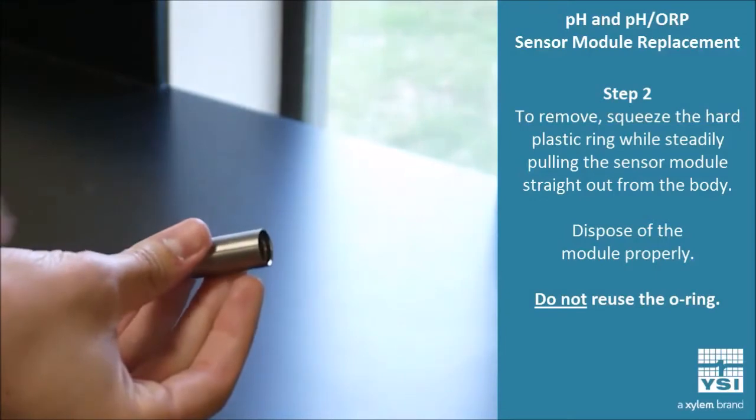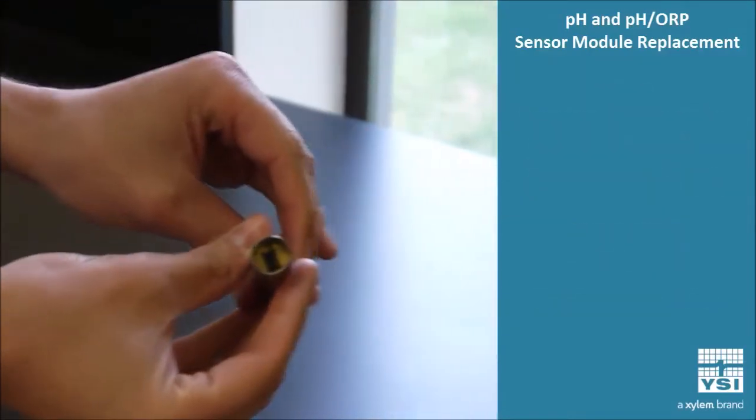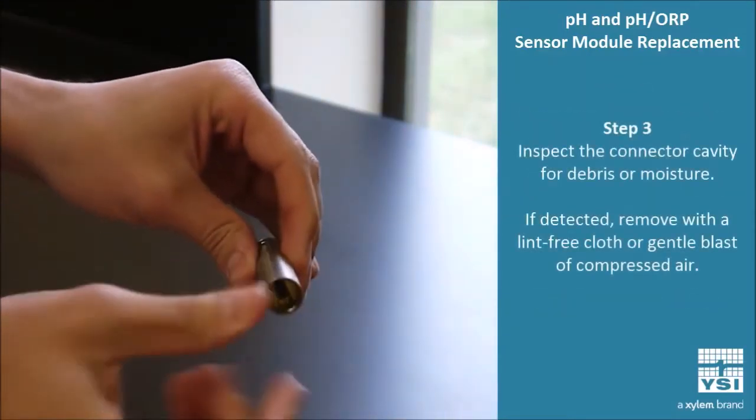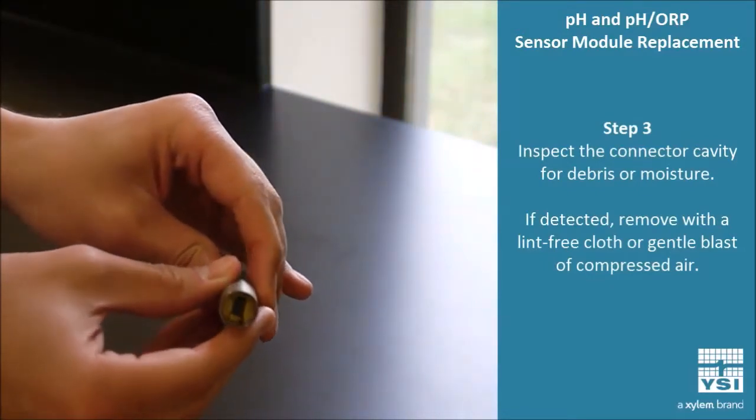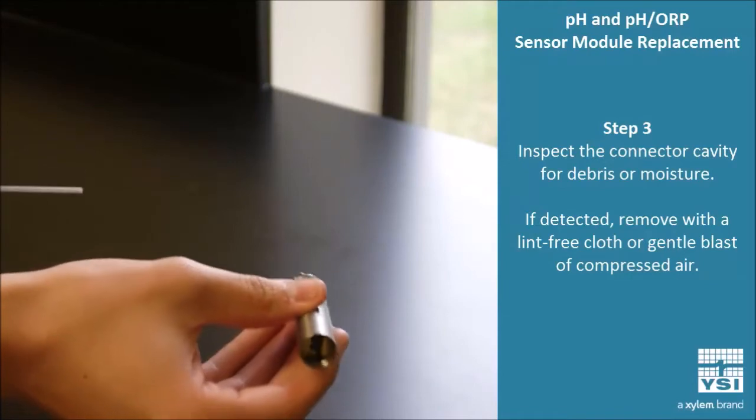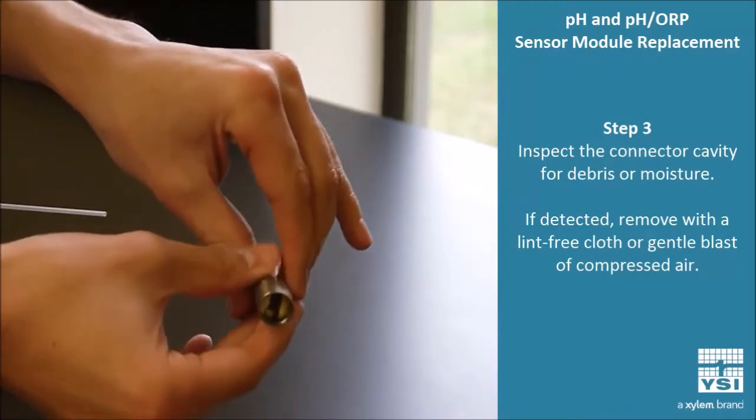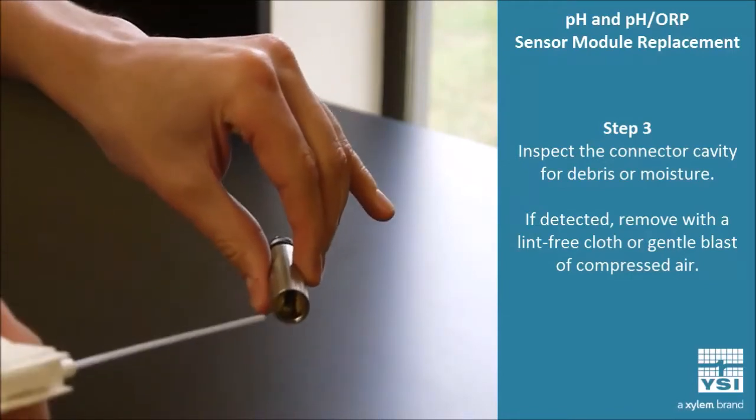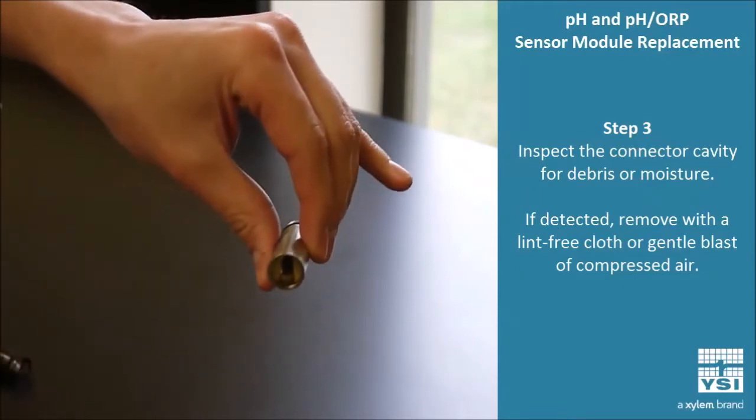Now at this point, it's very important that you take a look inside the cavity and make sure that it's clean of any debris. If you notice that there's anything in there, I recommend using a bottle of compressed air to just clean it right out.